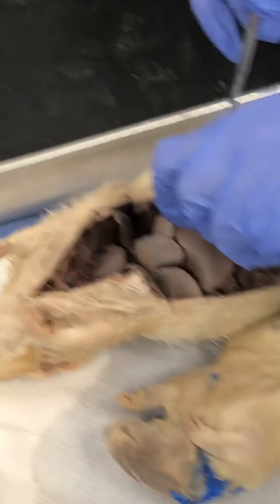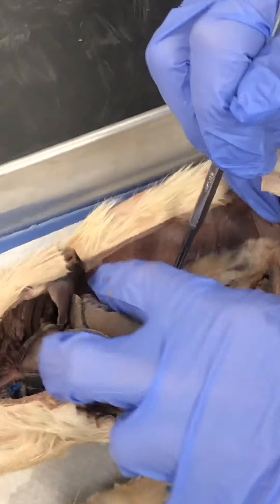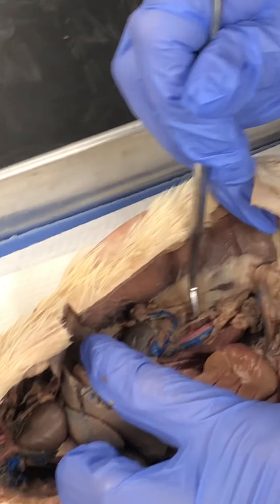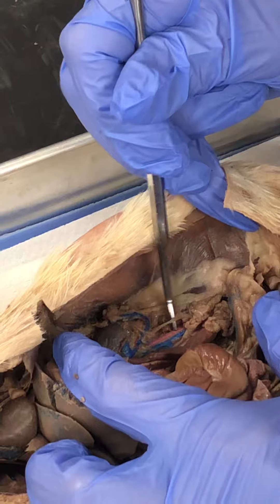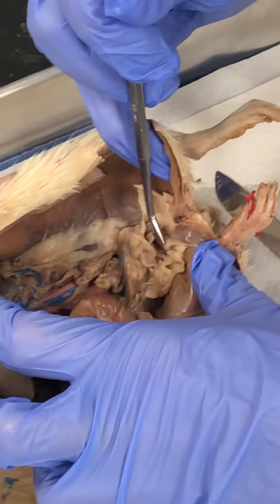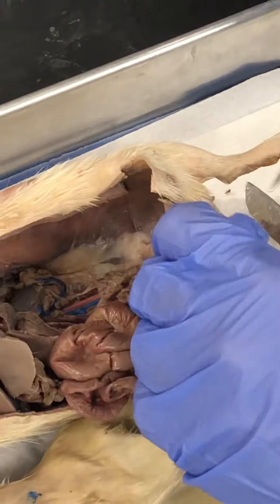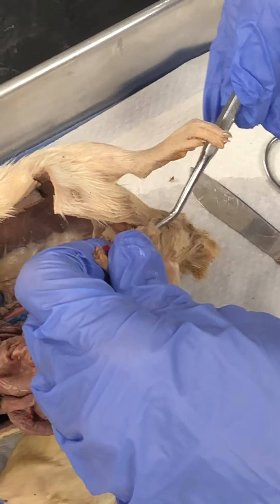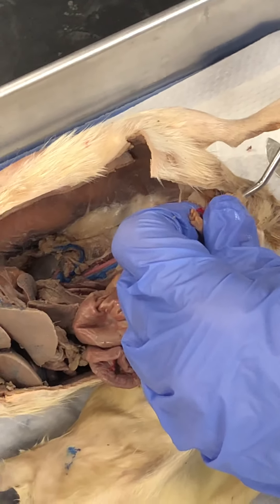Now we look at the urinary system. Here's the kidney. This tube is the ureter. Here's the bladder, and then this would be the urinary meatus or the urethra.